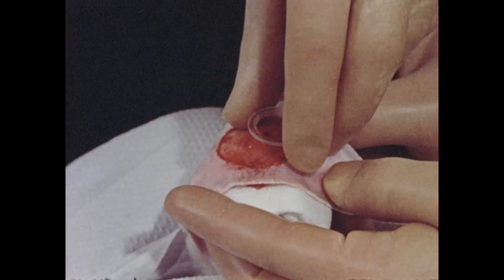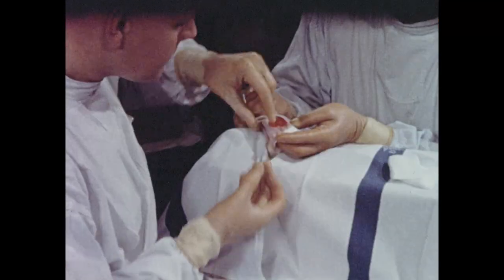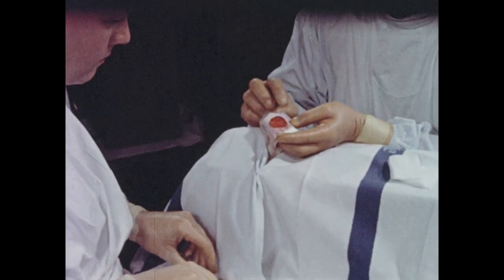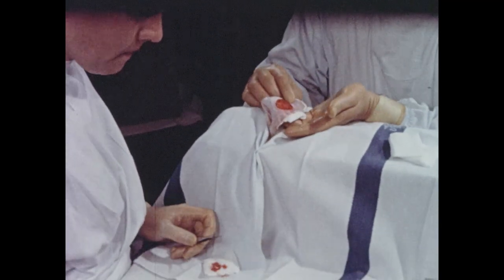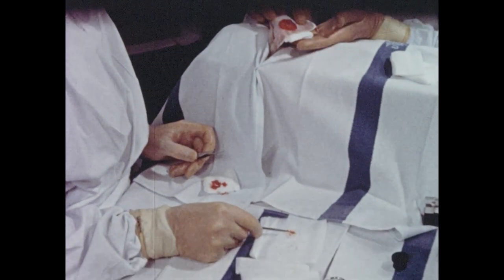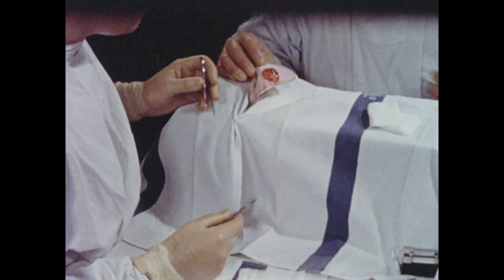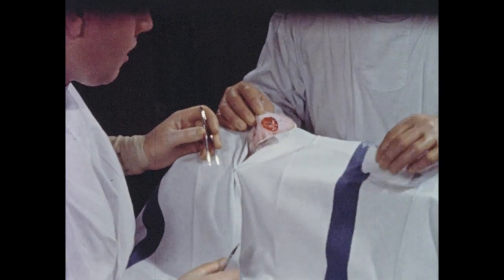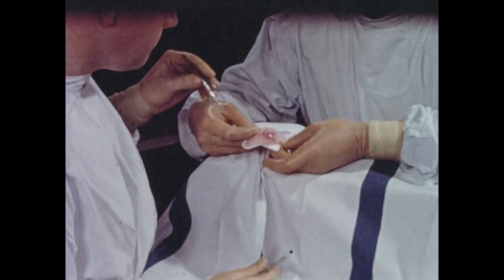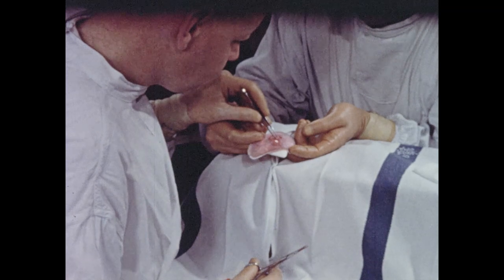A drop of fresh blood is now placed on the circular glass coverslip, spread out as a thin film, and permitted to clot. When the chamber is assembled in the rabbit's ear, this clot will represent the central observation area. During subsequent weeks, this clot will undergo organization with the ingrowth of newly formed blood vessels, which eventually may be used for microscopic observation.